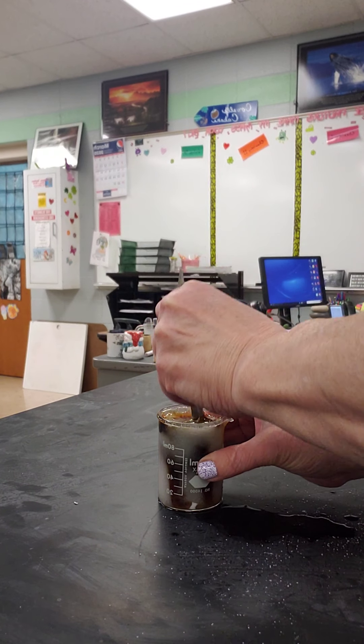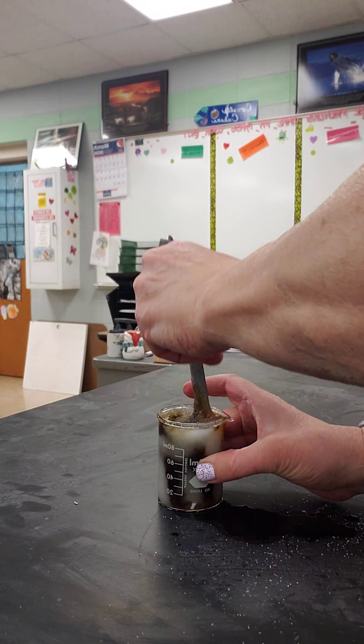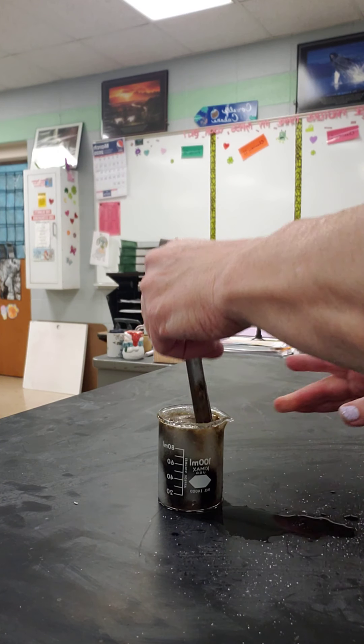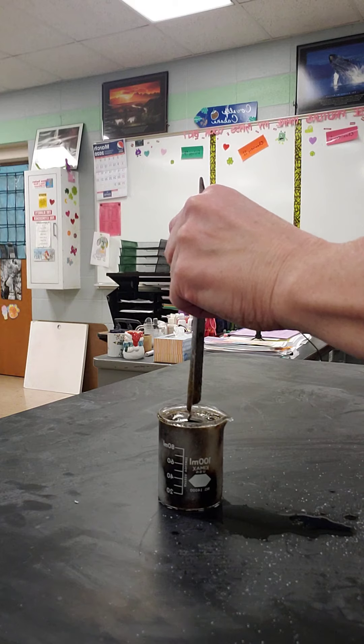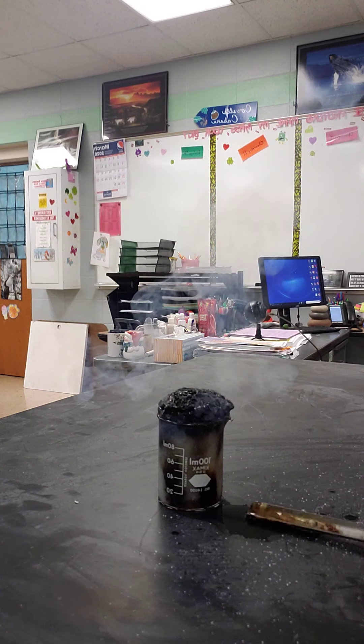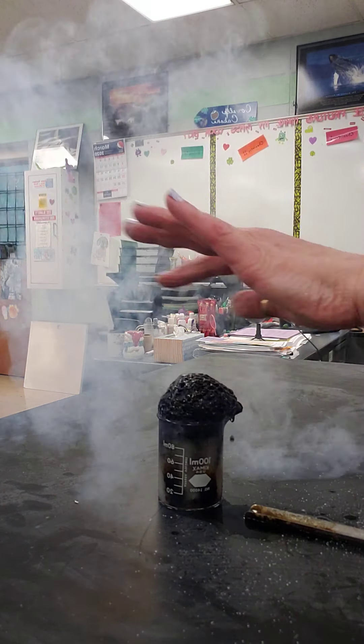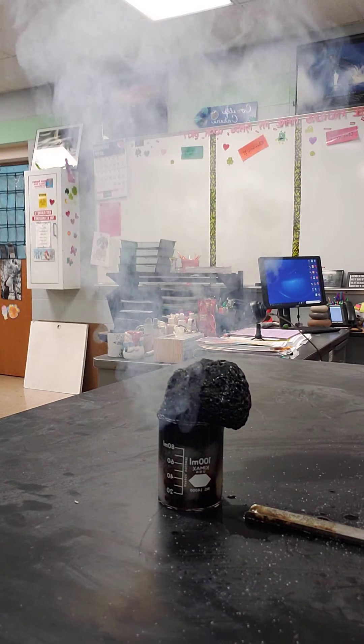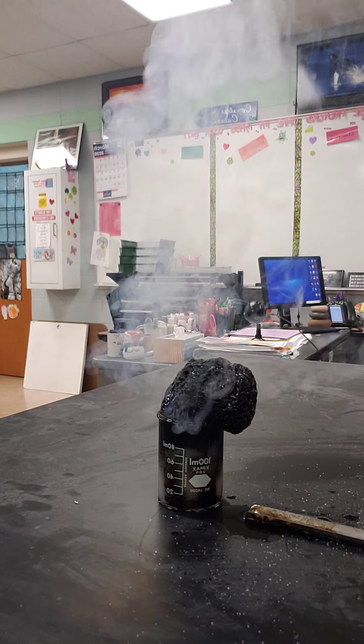Also to help the reaction happen a little faster. All right. So now you're seeing gas. That's water vapor and some carbon dioxide.